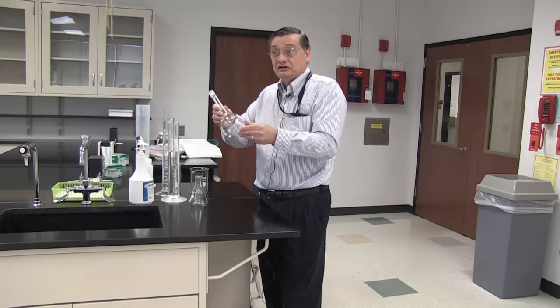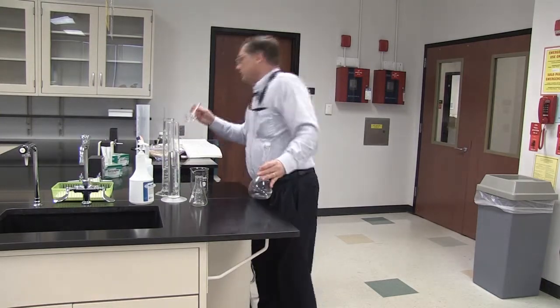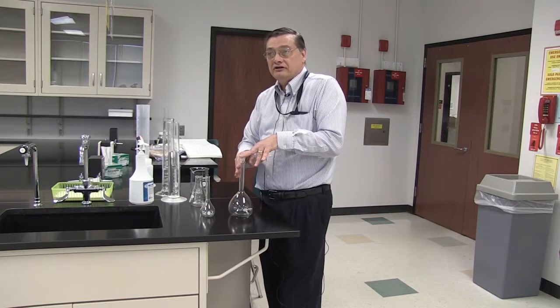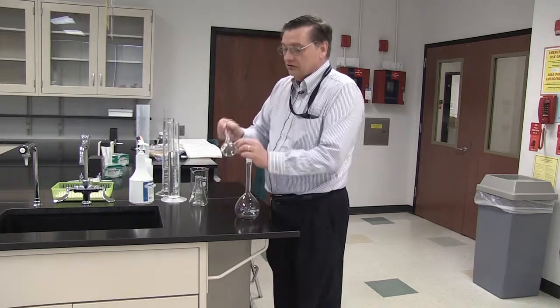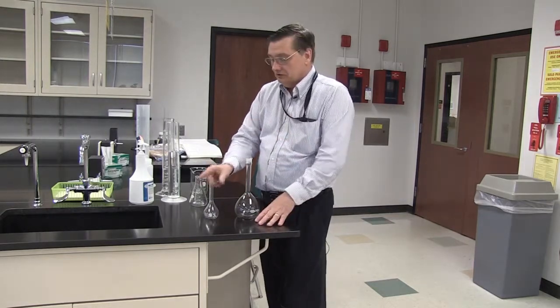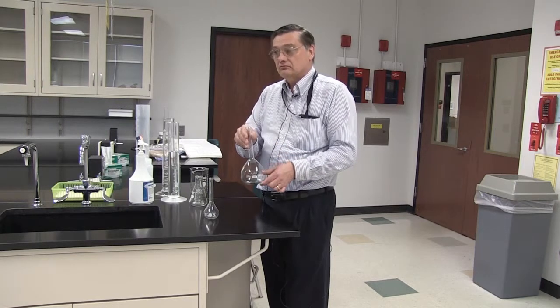So if you're making up a solution in this type of flask, then you can make it very accurately, but you can only do one volume. It's designed for a fixed volume, a 500 mil. I have here one for 100 mils. So it's very good accuracy, but it's designed for a fixed volume. Also, there's variability in accuracy between manufacturers on how carefully that line is etched. This flask has a B on it, right? So it has a little bit larger margin of error than an A-class volumetric flask.